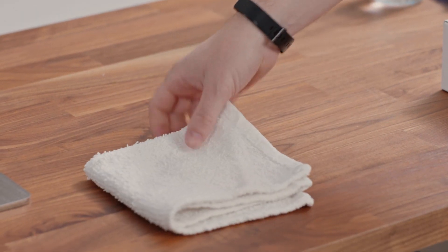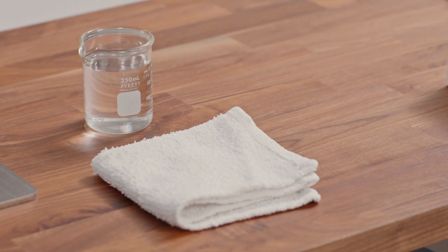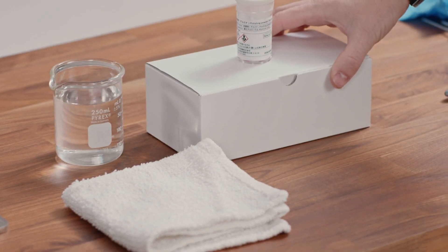In order to do this polishing, you need a clean rag, some water, and the alumina oxide powder that's included with the FC-800D parts.